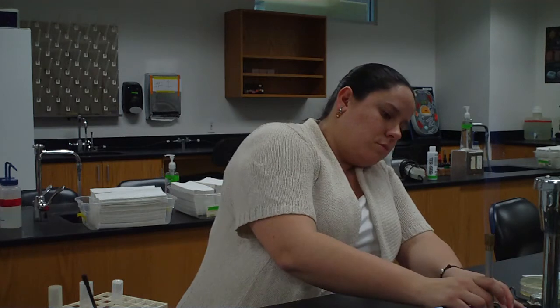It might be a little bit difficult to see through the camera, but hold on. We always have to adjust our Bunsen burner. Open up, there we go. You can adjust your Bunsen burner to have a nice blue cone within the flame. What we want is a short flame. We don't want it to be going up to the ceiling. And you see a nice blue cone in there, so we can use it for sterilizing our loops and needles and things like that.